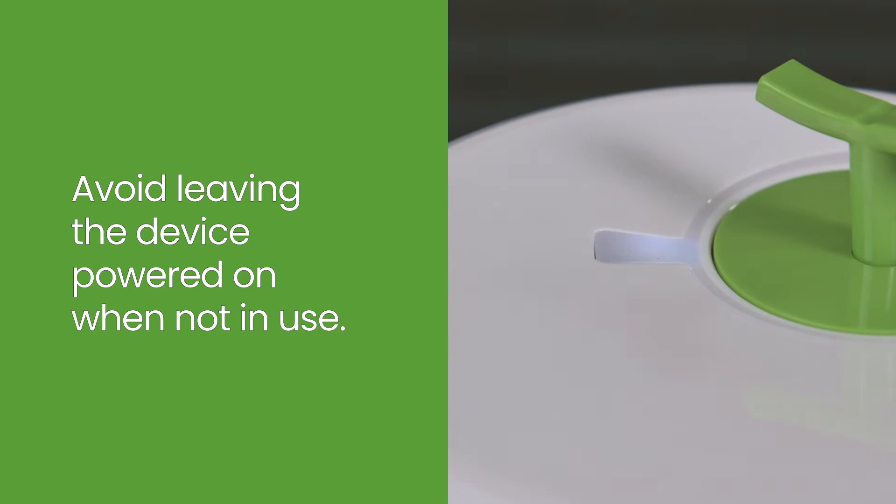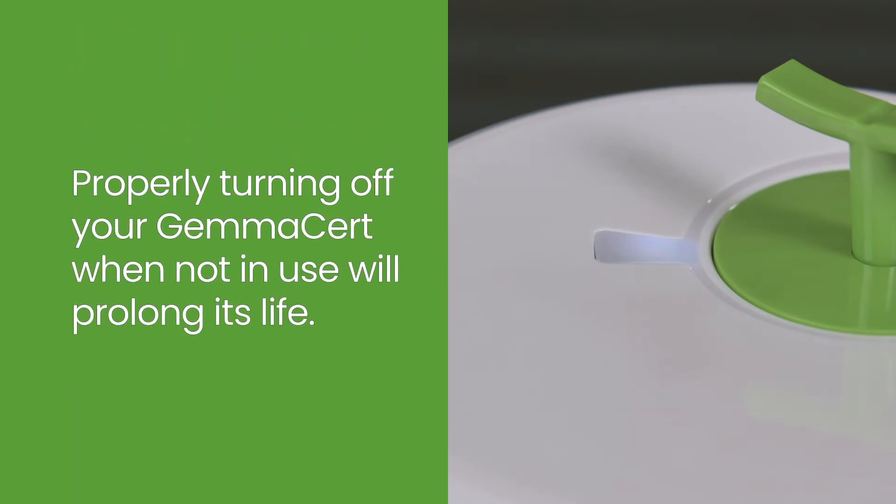Avoid leaving the device powered on when not in use. Properly turning off your GemmaCert when not in use will prolong its life.